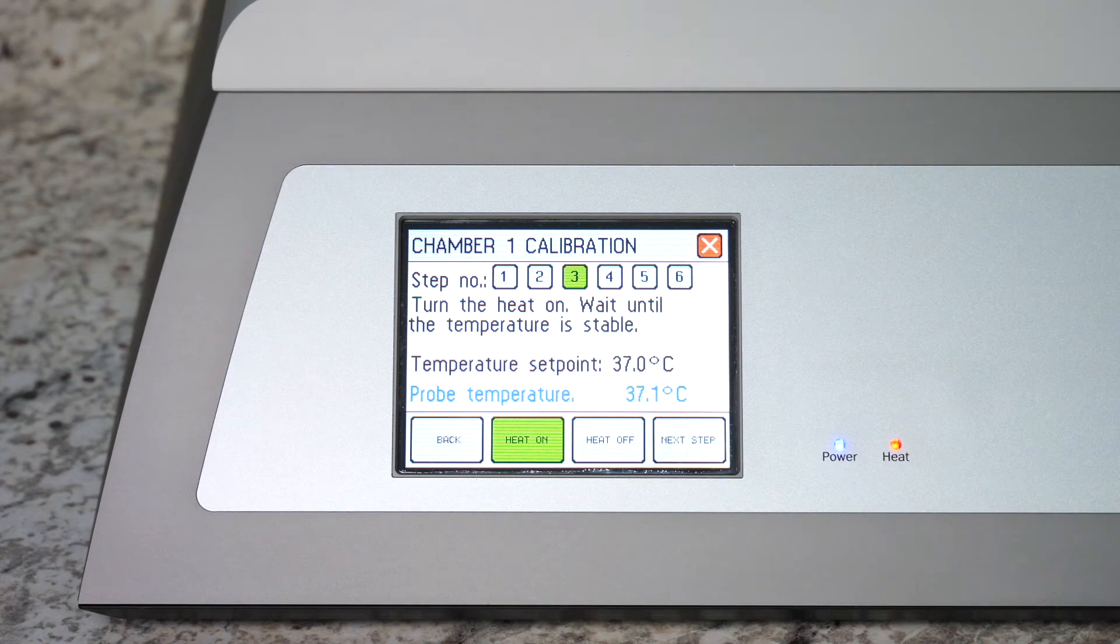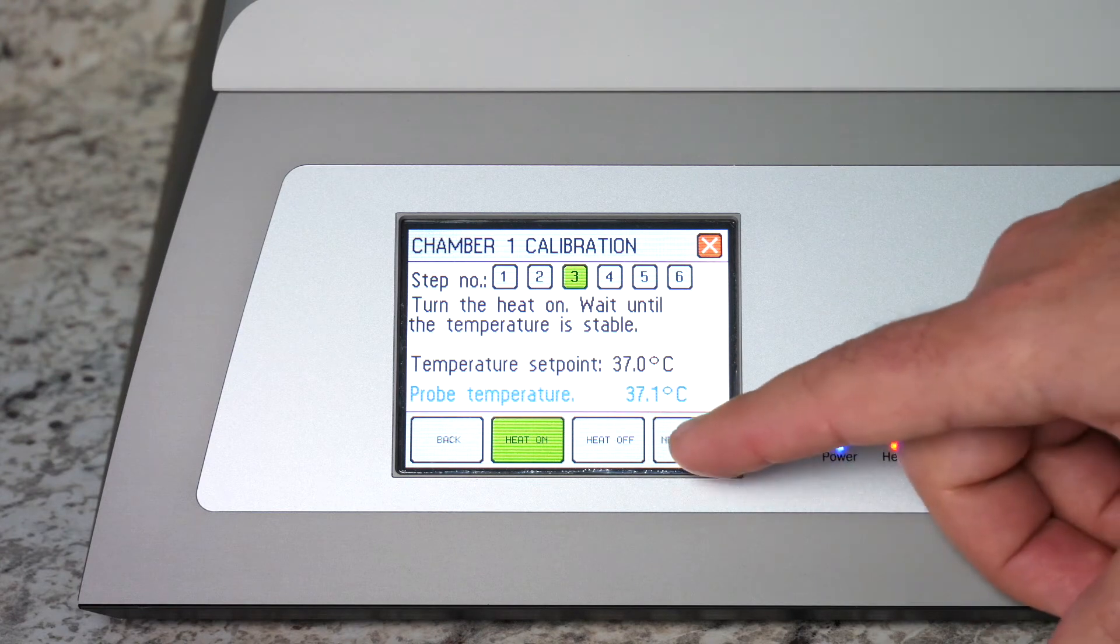Step three prompts you to turn the temperature on which takes about 20 to 30 minutes, so it's best if you start this before you begin your calibration procedure. In this case we are at experimental conditions so hit next step.